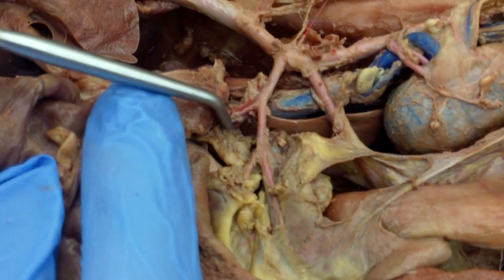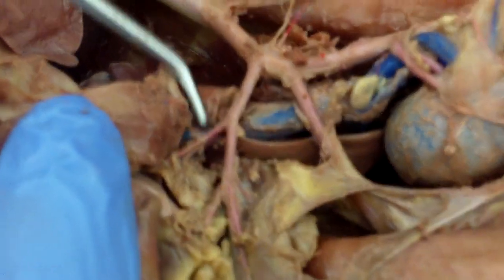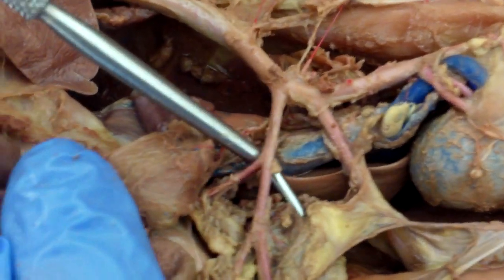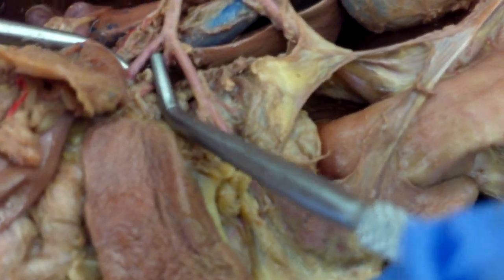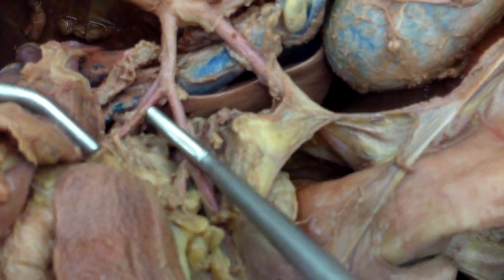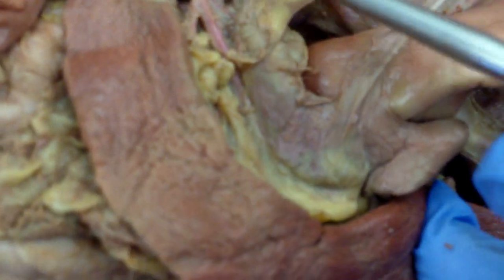The first branch of the celiac trunk is your hepatic. The next one goes to your stomach — that's the gastric; they're very close together. And the next one goes to your spleen — so that's the splenic.